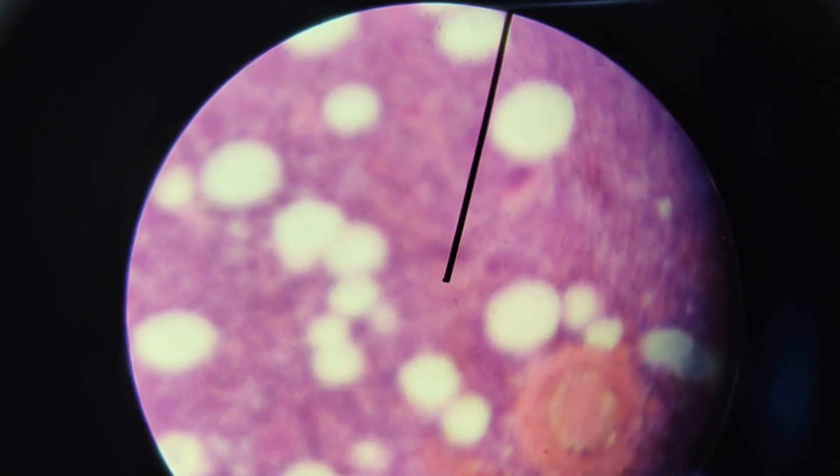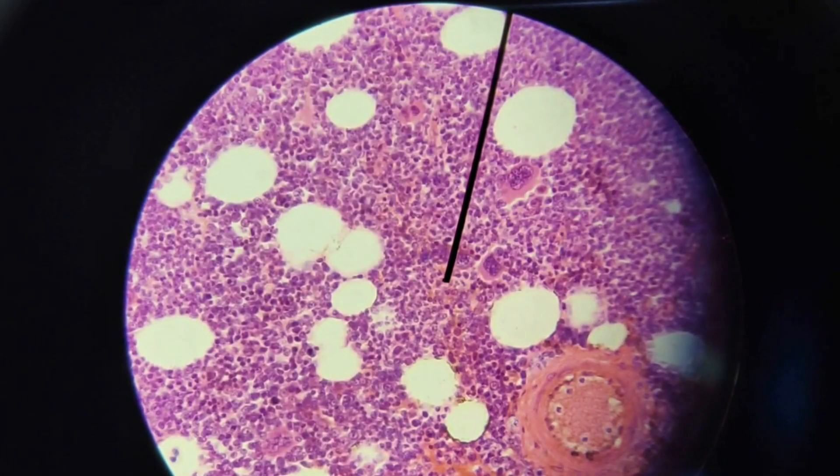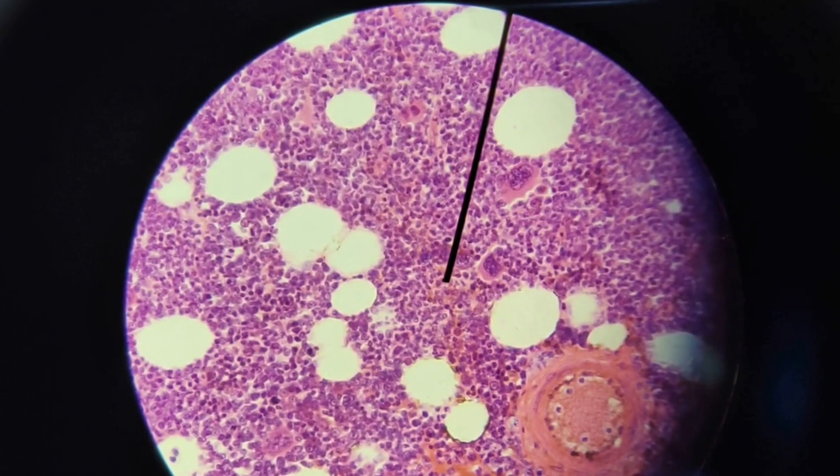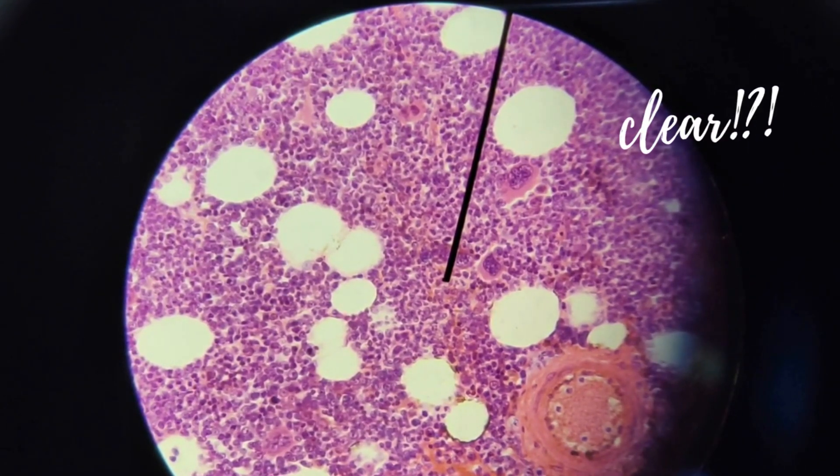I'm going to use the fine adjustment knob to make the image clearer. Once it's clear like this, you can stop using the fine adjustment knob.